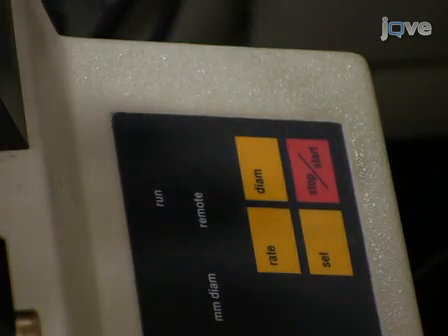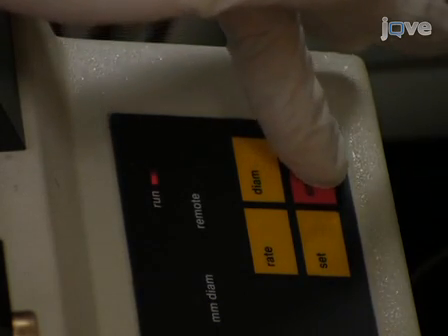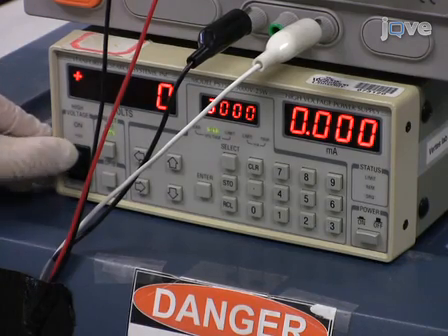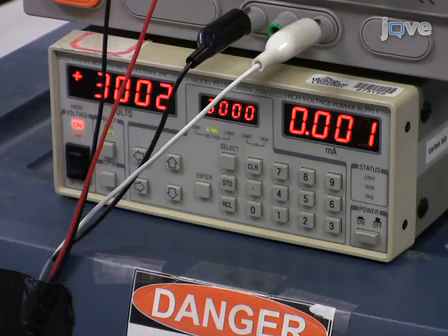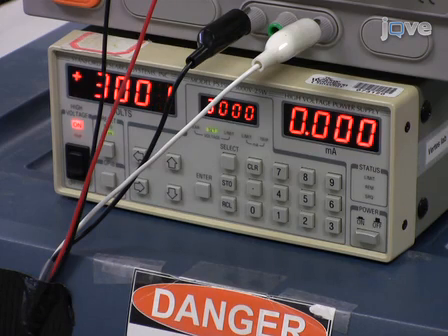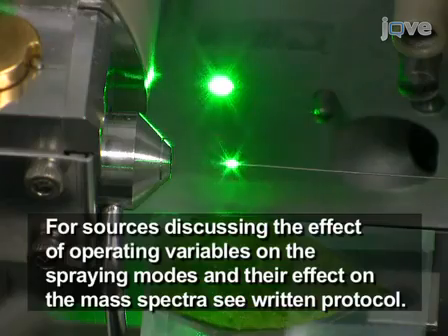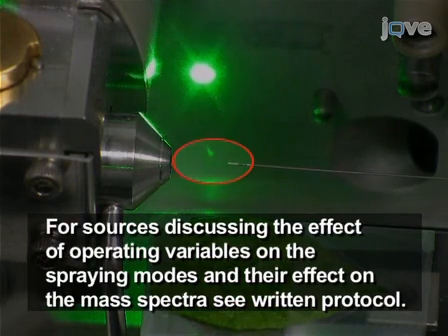Use a syringe pump to deliver the electrospray solution through the electrospray emitter at a flow rate of around 300 nanoliters per minute. If the mass spectrometer orifice is kept at a low voltage, for example below around 500 volts measured against ground, generate electrospray by applying high voltage, for example 3000 volts, directly to the electrospray emitter or through a metal union. Operate the electrospray source in cone jet spraying mode for the most efficient ion generation by LAESI.